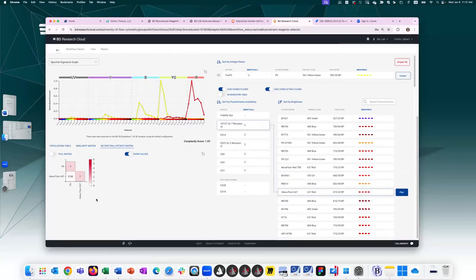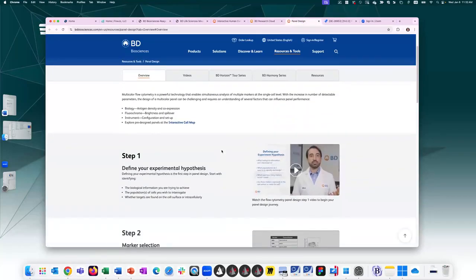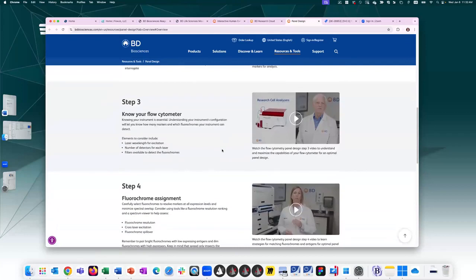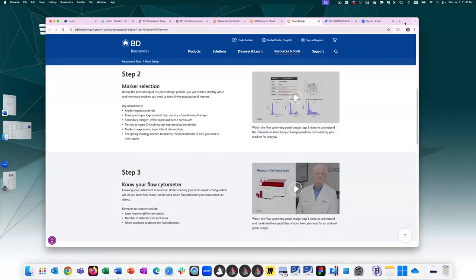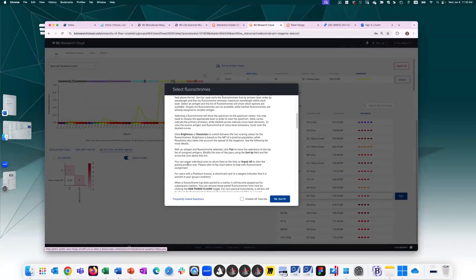If you want to better understand how to read the hotspot matrix, here are the two icons that I mentioned earlier in the slide. So we have the tutorial that I can click on it. The content of the tutorial changes based on what page you're on in BDRC. So here we have several links to learn more about panel design. Click here. This will bring me to a BD page where it goes through those concepts of good panel design. If they're not top of mind, you can click on it and reread them to know how best to assign your fluorochromes.